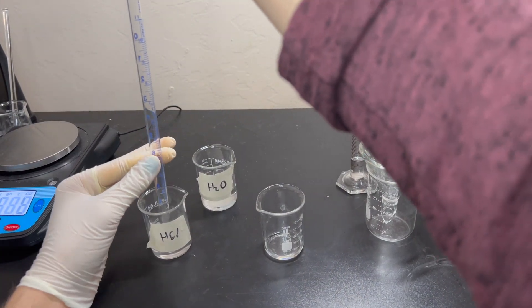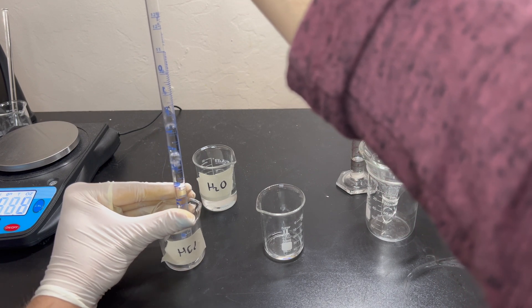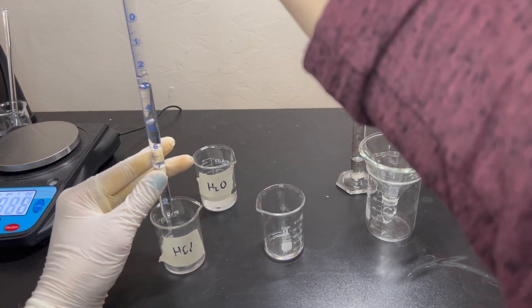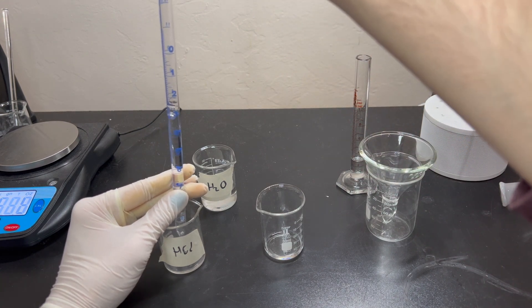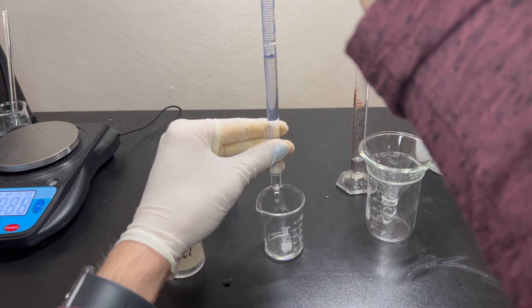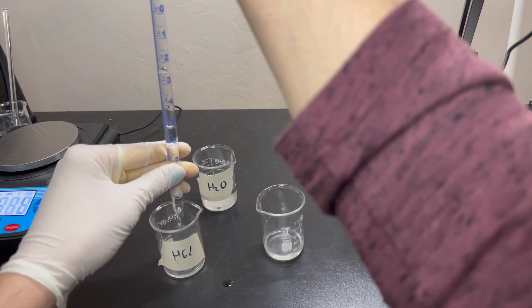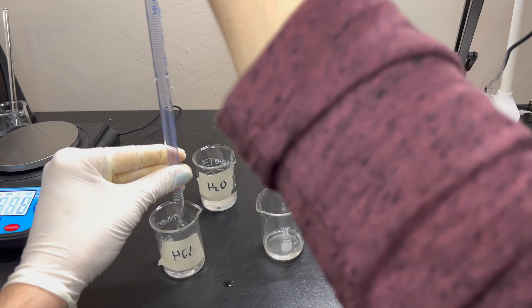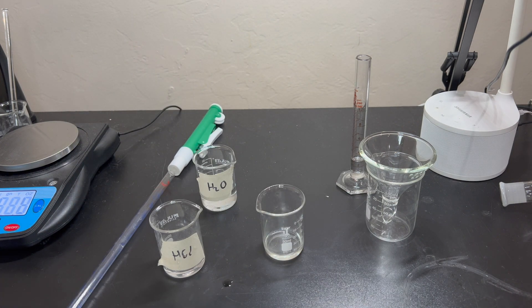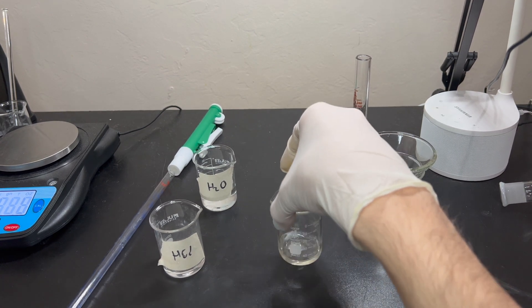Not pretty stuff. I know that I'm using the same pipette as before. It doesn't really matter in this case. And I'm going to use it wrong as well, because I don't want to waste hydrochloric acid. So, we need about 2 mils of hydrochloric acid. We're at 3 right now, so we should go down to about 1. There I go, spilling hydrochloric acid on my table. I'm going to put the rest back in. That's just going to be thrown away. I'm just going to clean off that a little bit. Don't want to leave concentrated hydrochloric acid. So, again, go ahead and stir it.